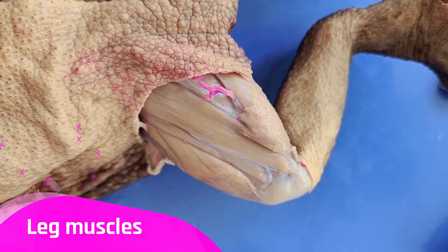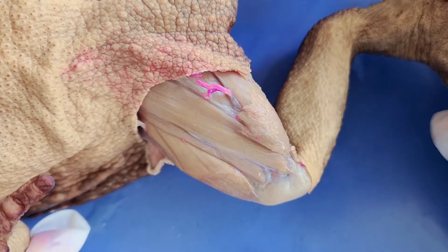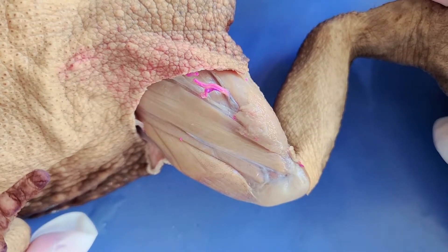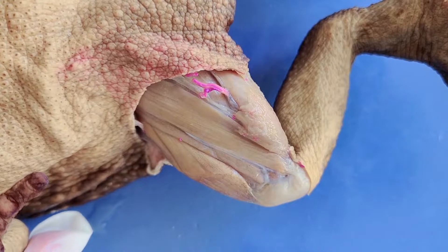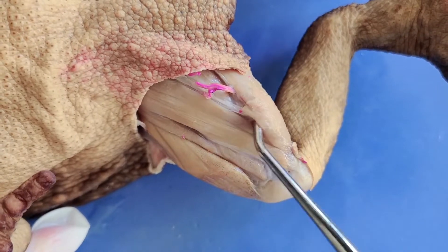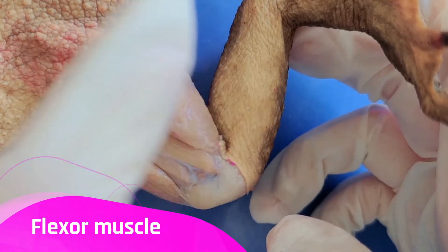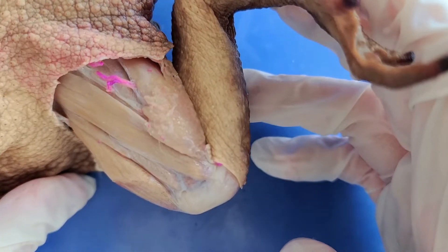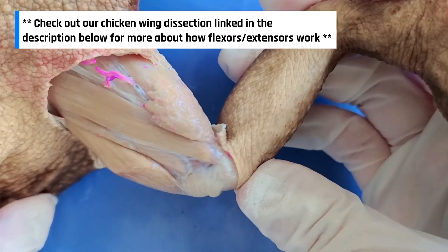Now you can see the leg muscles. While frogs leap and jump, toads actually prefer to walk or hop most places — that's why toad legs are a lot shorter than frog legs proportionally. Still, the leg muscles in toads are very important for locomotion. You can see several different muscle groups here in the leg. This is the flexor muscle for this joint, because when it contracts — meaning the muscle becomes shorter — the knee joint is going to flex. This would be the extensor muscle, because when it contracts, it will make the knee joint extend.